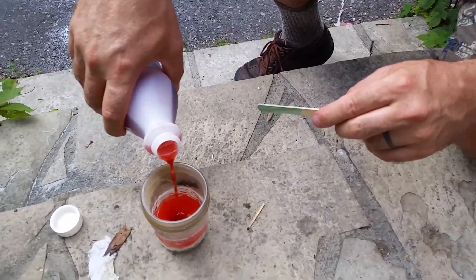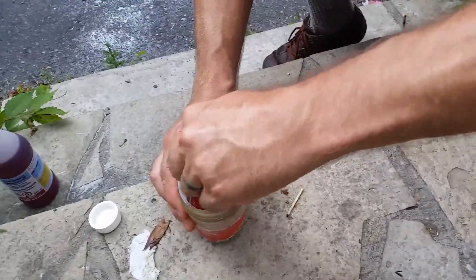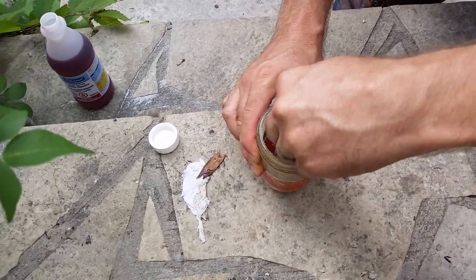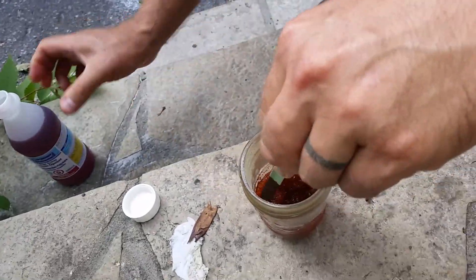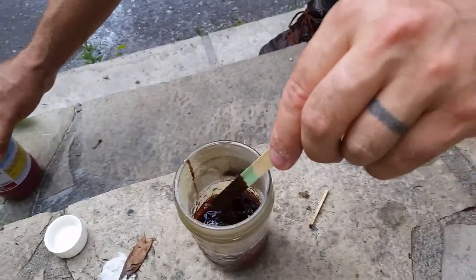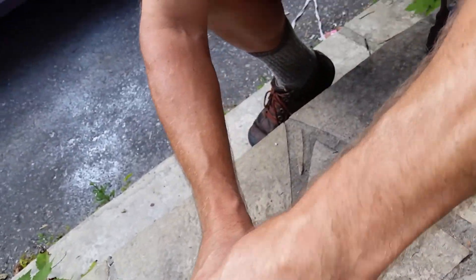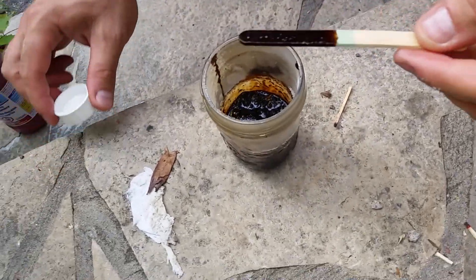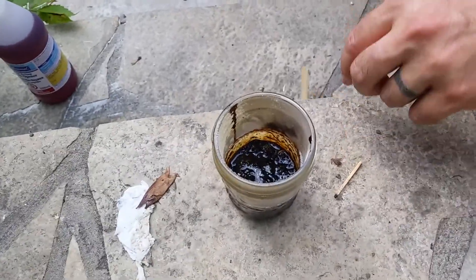Just a little bit. Yeah, and then just mix it. You sure that's enough water? You might need a little more. Oh, look — it's already starting. Put a little more in. Look at that, the sugar's turning black. It's getting hot, the jar's getting hot. Let go of it, take the popsicle stick out. And then you just need to wait — just until you start seeing stuff happening. It's looking good so far.